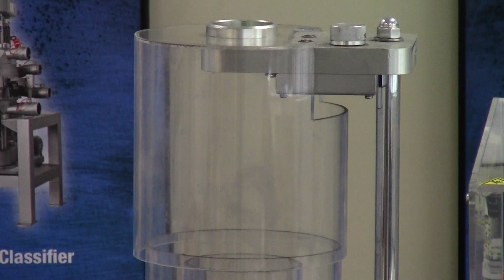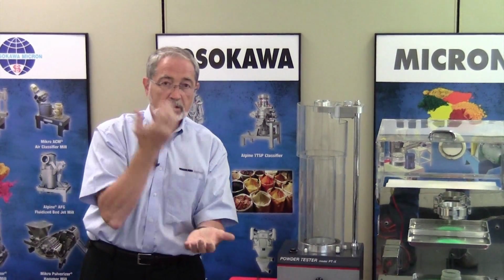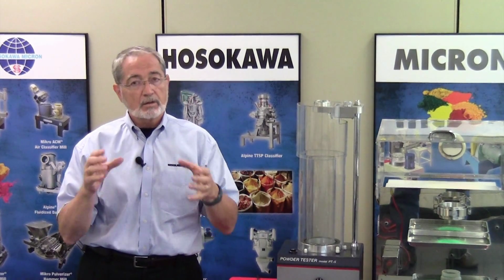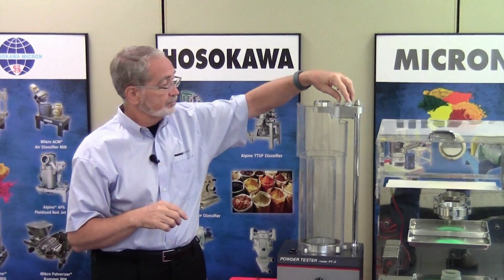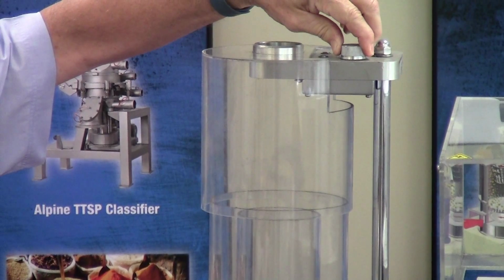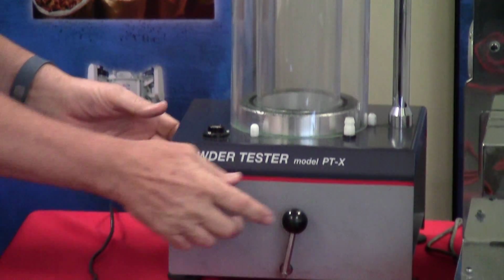Now, what occurs is you not only have the product falling, but you also have the product slapping against the glass or splashing. That's all taken into consideration during this test. So, are you ready? It might be a little fast. Okay.